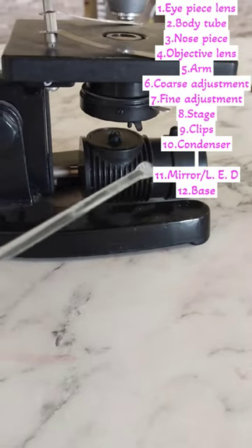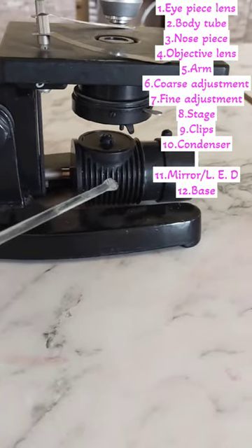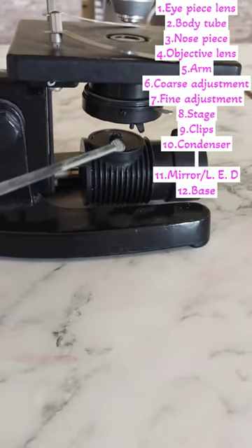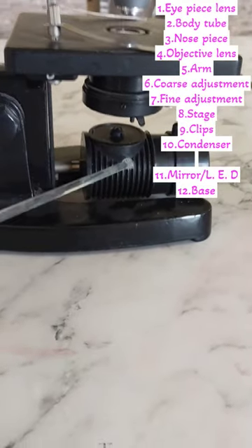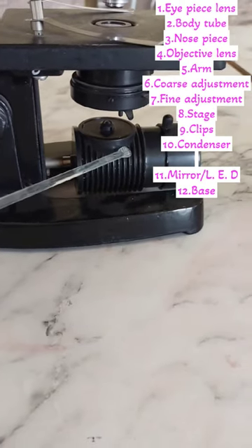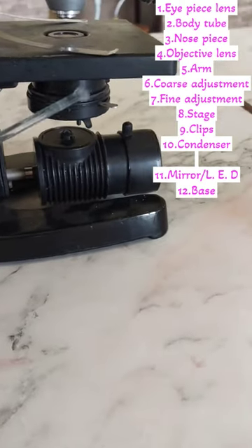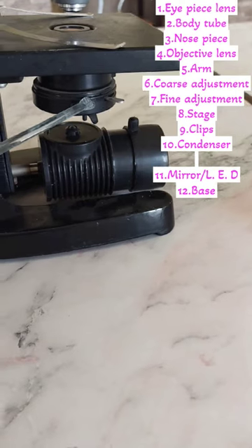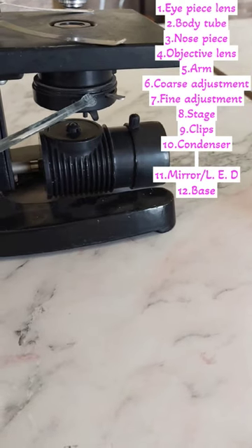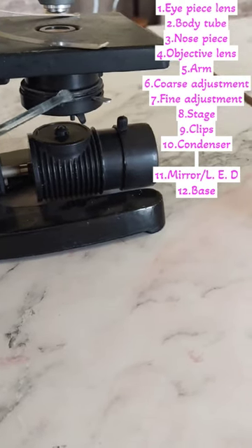When light comes to the specimen, the image is formed at the objective lens. The objective lens image is then focused through the body tube and the eyepiece lens, which is how the specimen is magnified.